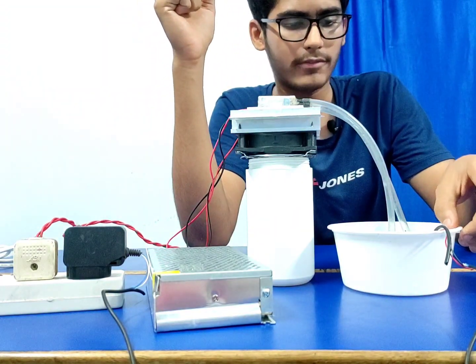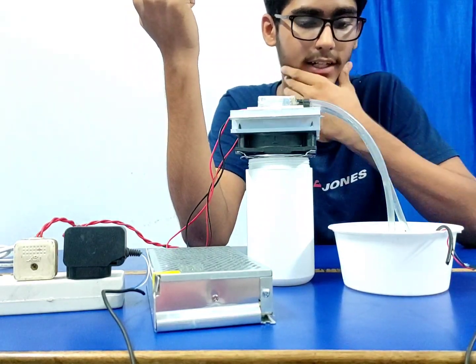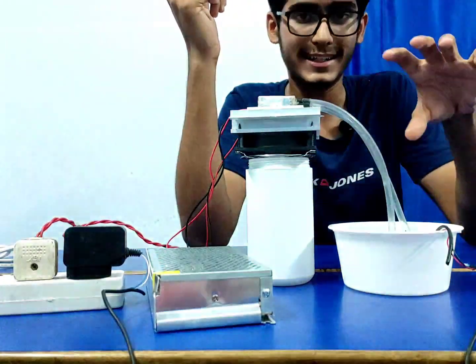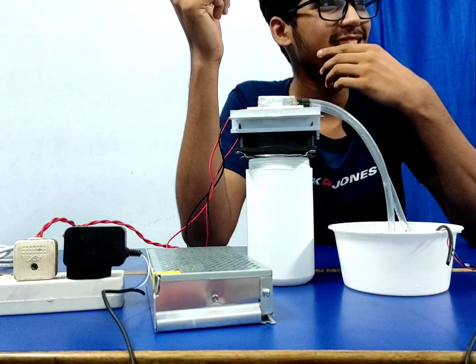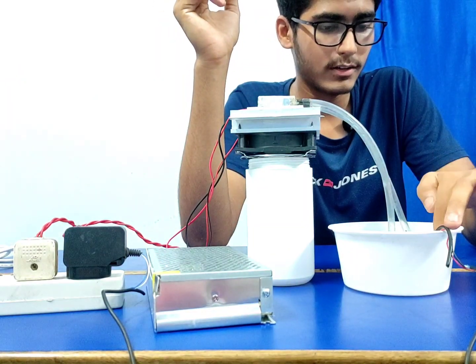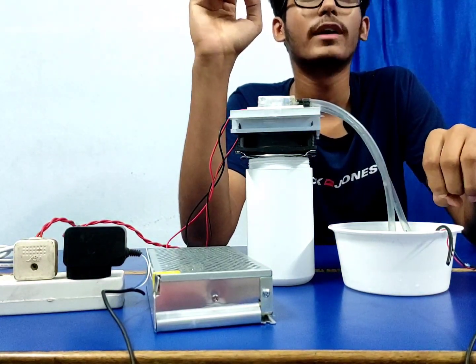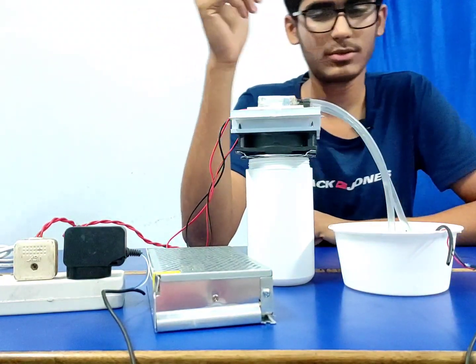After nearly 10 to 15 minutes, this module can create a temperature difference between the water we started with and the water after 15 to 30 minutes. We will get at least a 20 to 30 degree difference in temperature. The water in my house is nearly 35-37 degrees, maximum 40 is too much. If we turn it on for nearly half an hour, we will get nearly 20 degrees, and below that also I got 11 degrees. It's quite chilled. We can use it to cool anything.